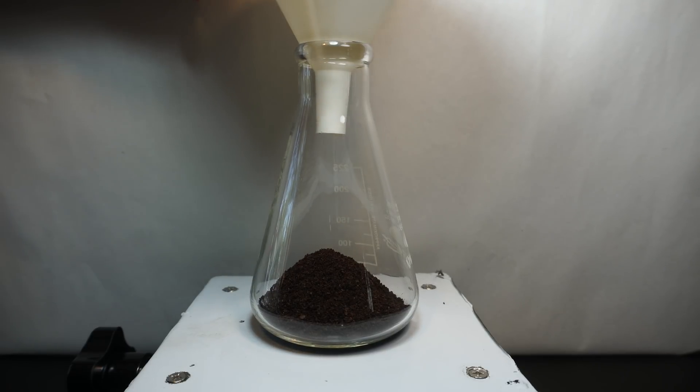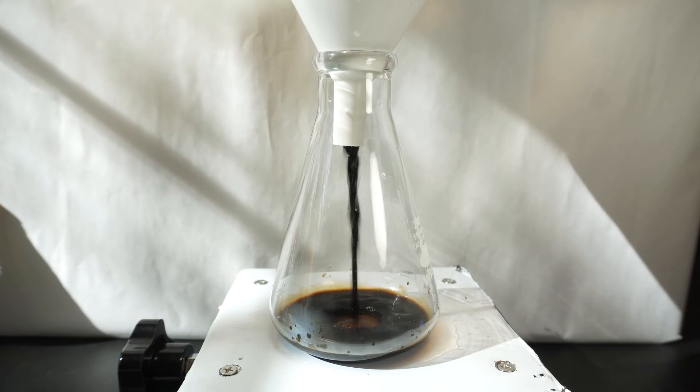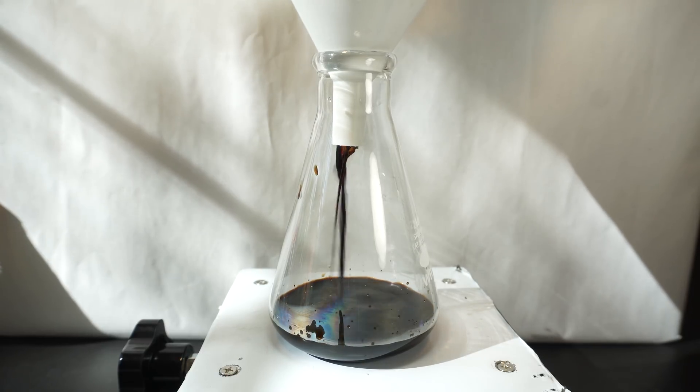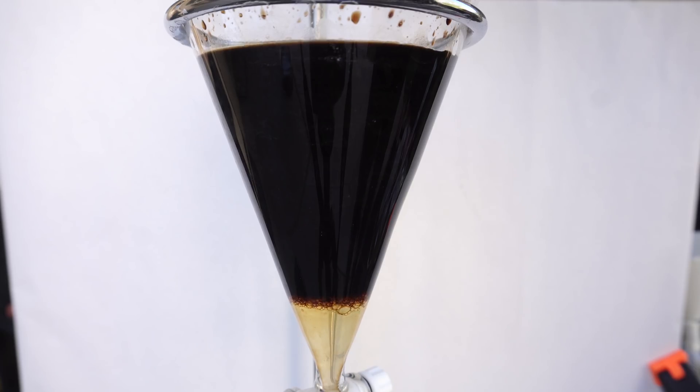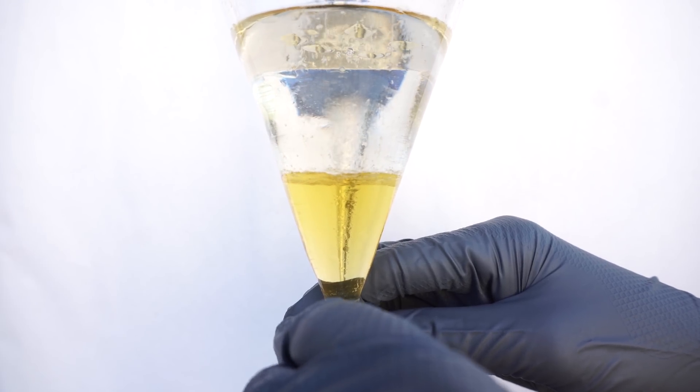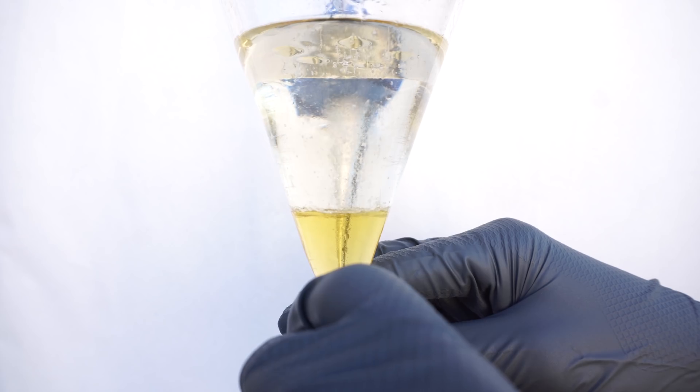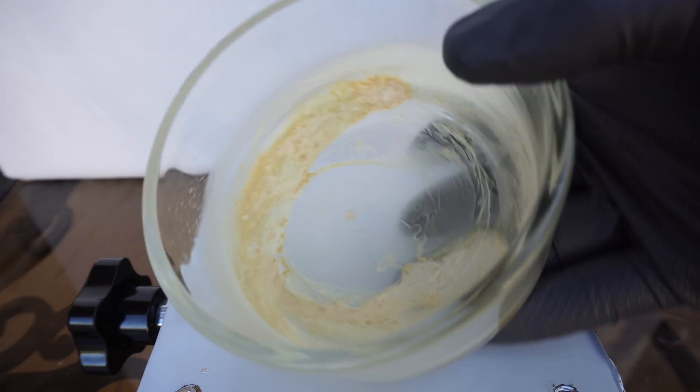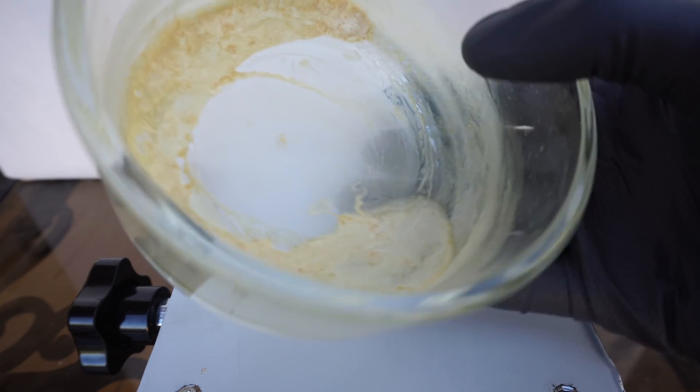Caffeine is by far the most used drug in the world. From old to young, caffeine is consumed by almost everyone. I personally prefer coffee and honestly can't imagine having to go a day without it. As a chemistry enthusiast, I have always loved recrystallizations, so naturally extracting caffeine from coffee and recrystallizing it has always been one of my goals.